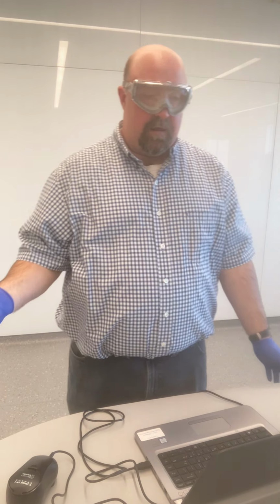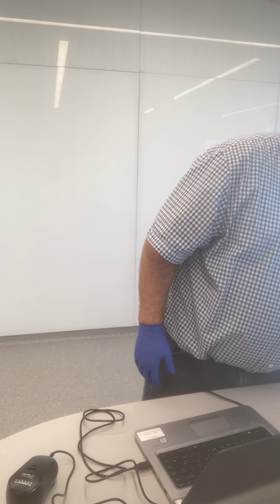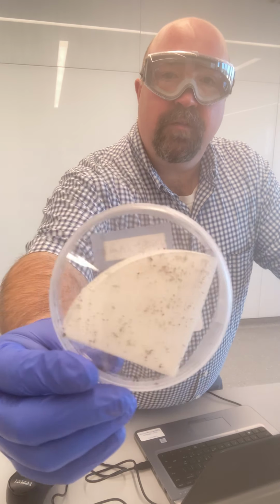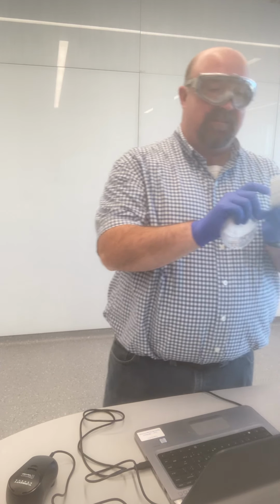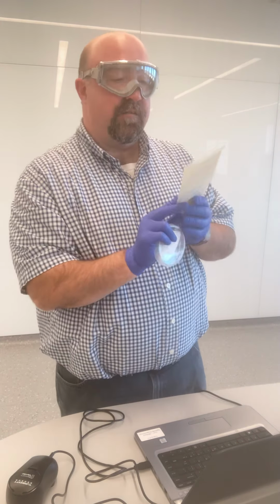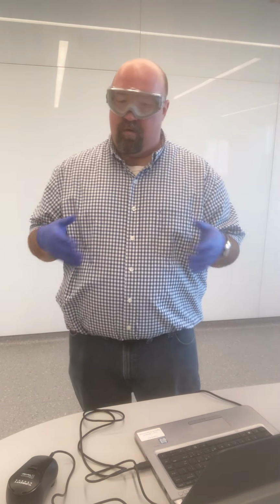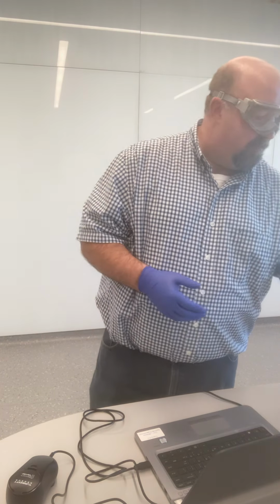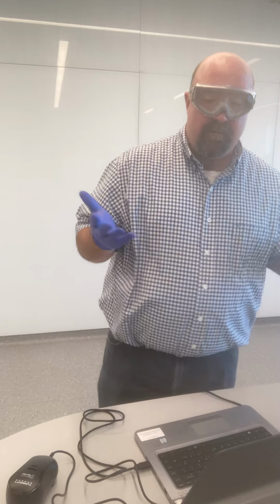We've filtered the sample and dried it all out. And what we have now are these Petri dishes, which have the filter paper and the dried solids all ready to go. We have the initial weights here, so I'll provide these for you in the data spreadsheet. These initial weights are the weight of the Petri dish, the filter paper, and everything before filtering. Then we filtered it, and so now I'm going to find the mass of the dishes with the solids.